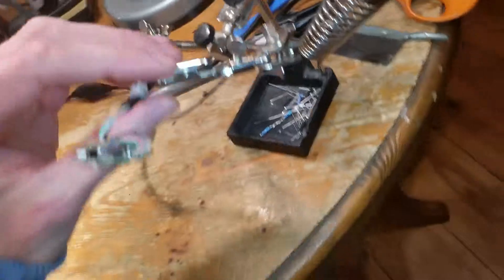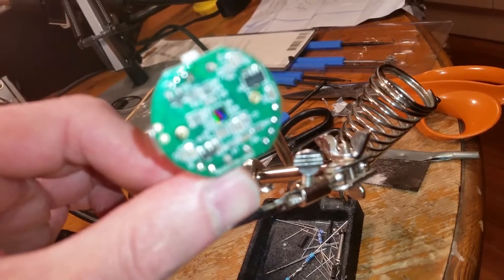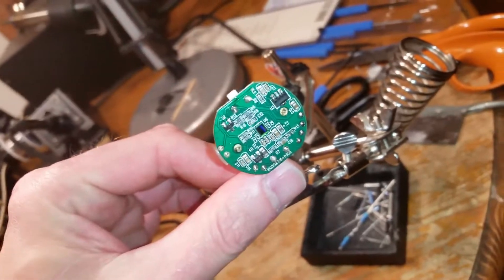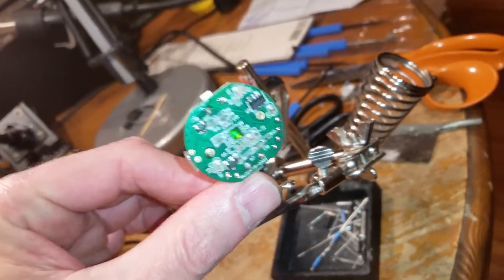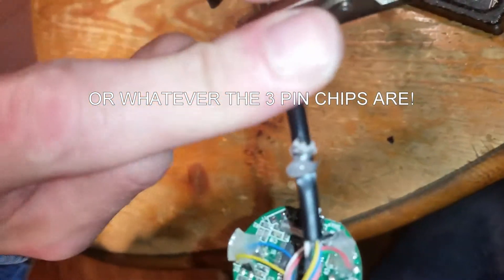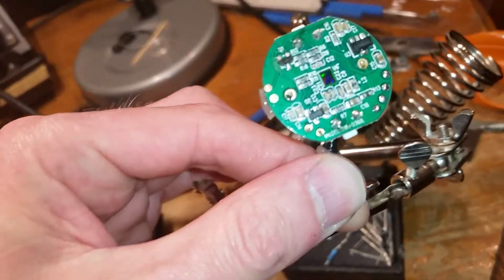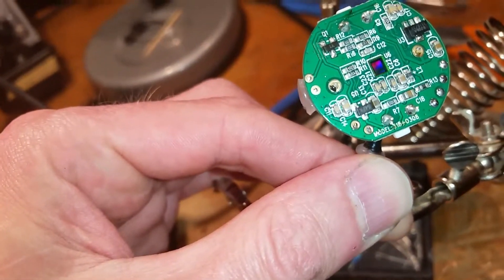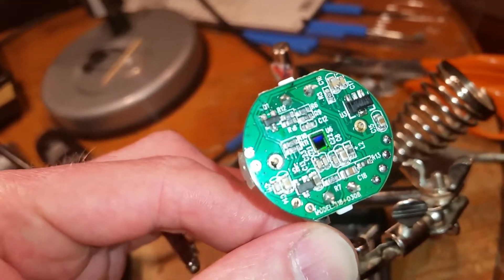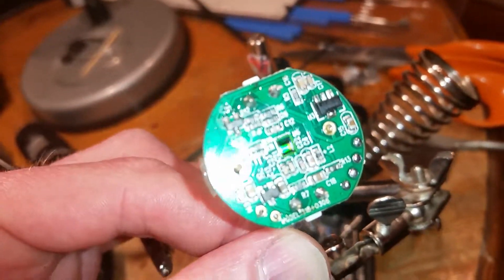I just went over the connections on the USB - actually the four bottom dots on the right. Went over the four bottom dots on the right. That's a photocell in the middle, don't touch that. Went over the voltage regulator there on the right top, and there's a little voltage regulator on the left bottom there - the two pins at the bottom, two pins at the top. That little regulator there on the top left. And now it works, to my amazement it is now recognising.